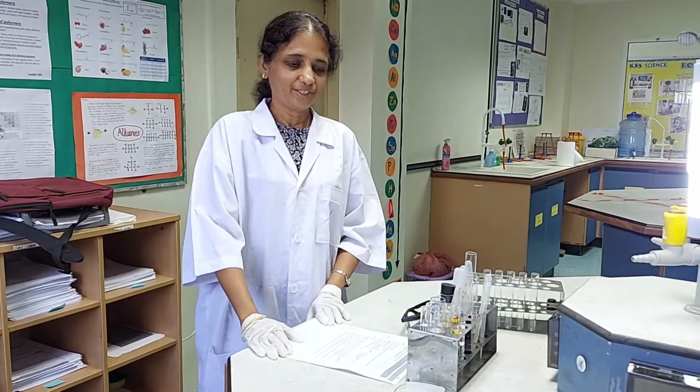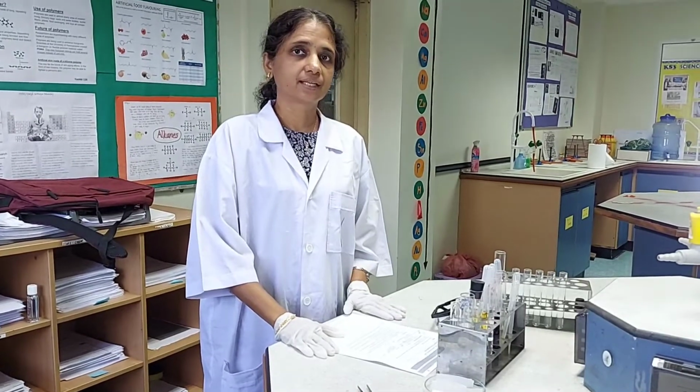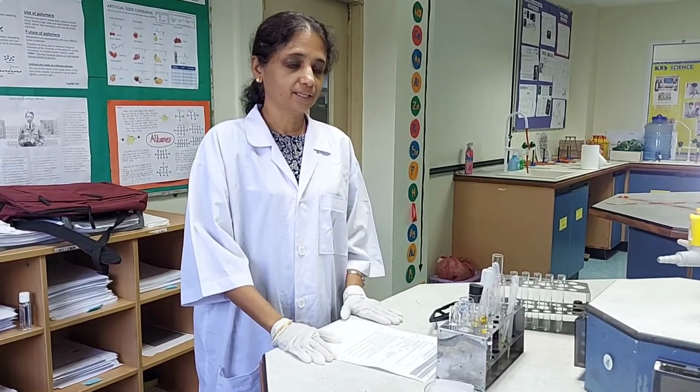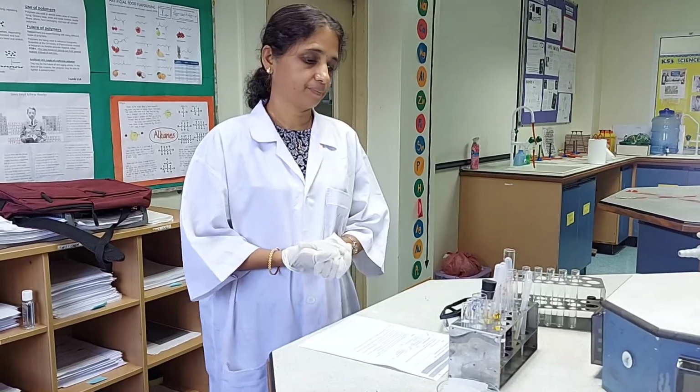Good morning. Today we will do an interesting practical on the redox behavior of some of the transition metals. The transition metals that we will be looking in detail will be iron and the two valencies of iron, iron 2 and iron 3. We are going to look into the redox behavior of that. And then we will also study the manganese 7 to manganese 2 behavior.